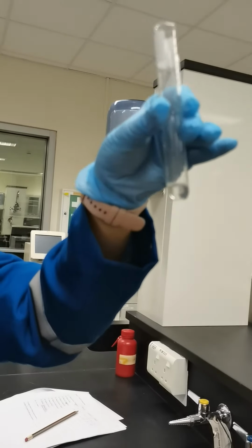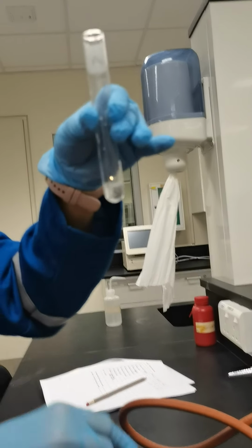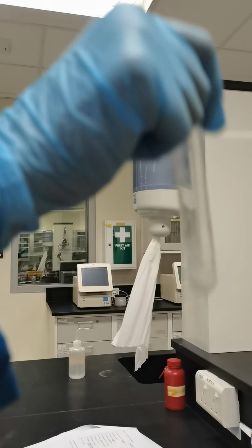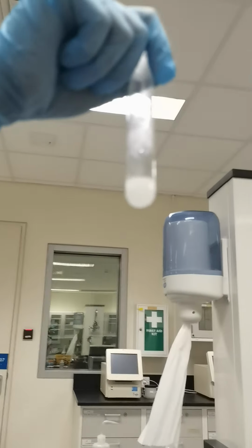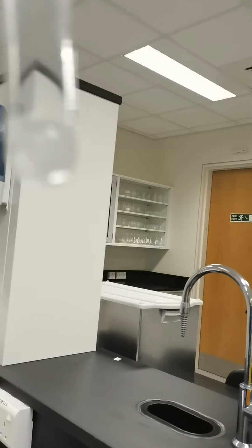I think we need to add a little bit more. And now they can see the reaction.